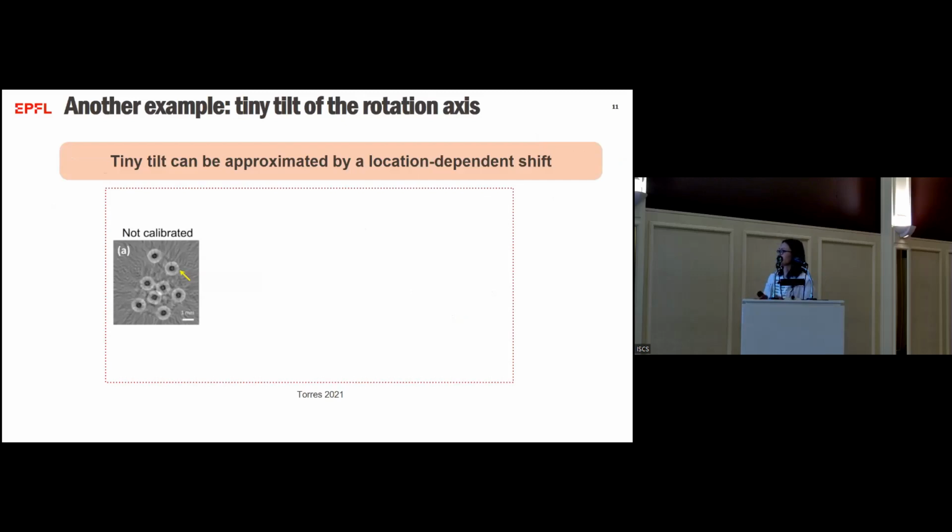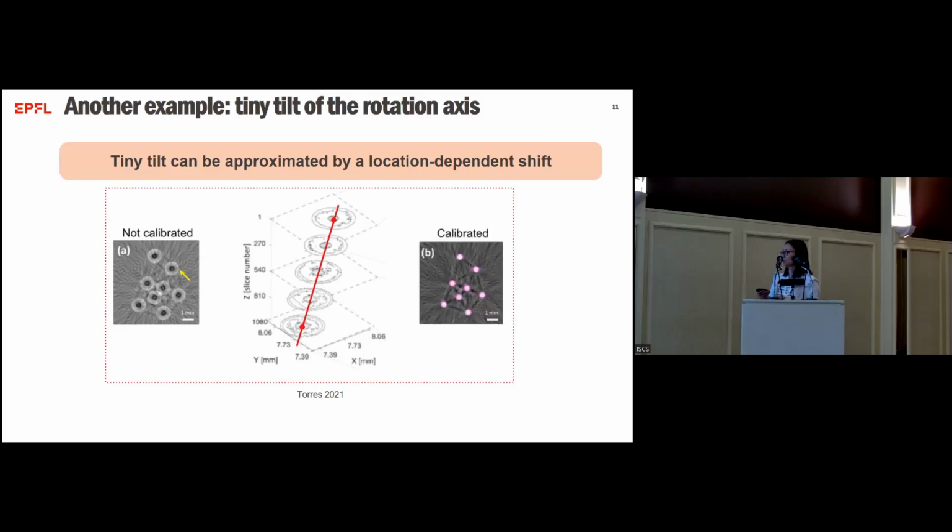In this non-calibrated image, we see these shadows around the object. And typically, this is what people do to remove it. We apply a shift correction method, the max variance method, on the top slice of the sample to find the center of rotation. Then we apply it again on the bottom slice, then fit the line. And now we have determined the center of rotation for each slice. Then we have a calibrated reconstruction image without artifacts.